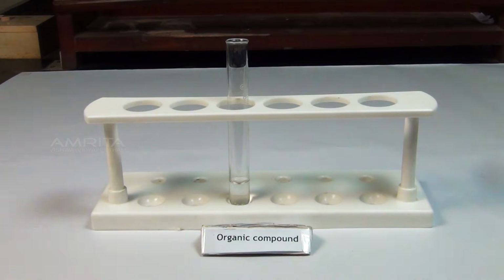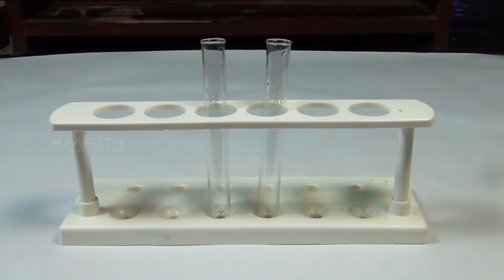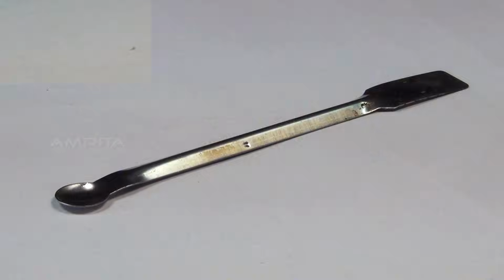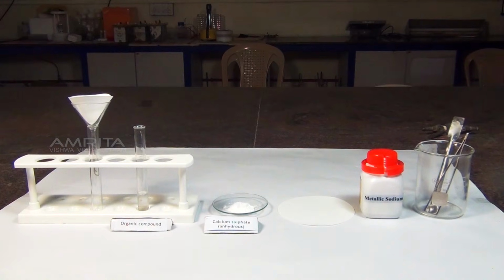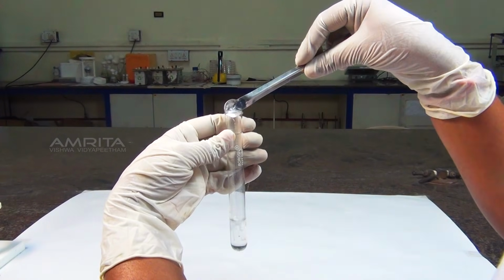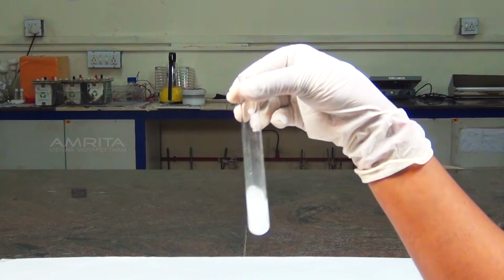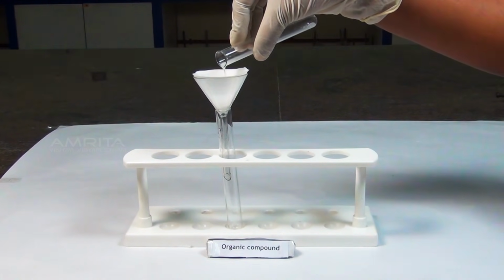Materials required: organic compound, anhydrous calcium sulfate, sodium metal, test tubes, funnel, filter papers, spatula and forceps. Procedure: take a small quantity of organic compound in a test tube. To this, add a small quantity of anhydrous calcium sulfate using a spatula. Shake the test tube well to remove any water content in the organic compound. Filter the contents into another clean, dry test tube.